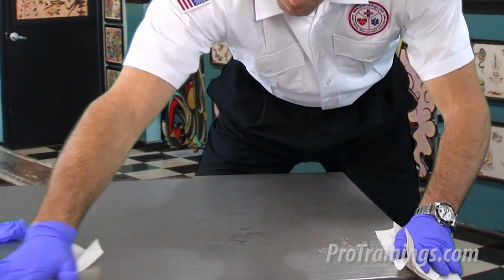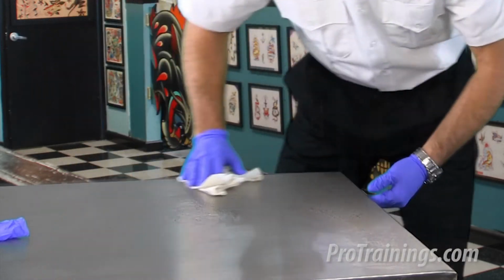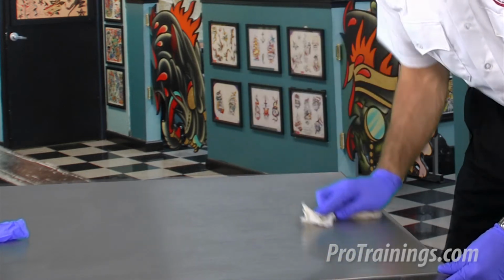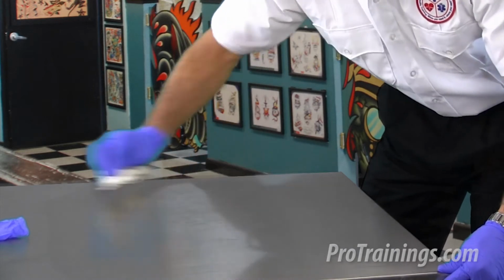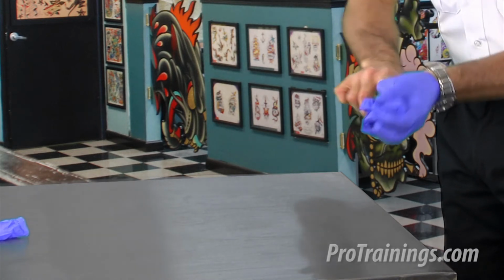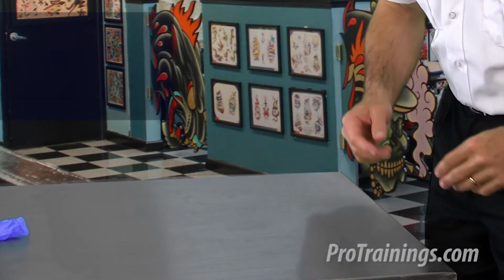Now we're wiping down the surface that's been sprayed with the bleach solution, in this case making sure not to cross-contaminate and spill it off the edges. If it does, then we're going to have some floor to clean up. Once again, glove on glove, skin on skin for removing the gloves. Now I throw those in the trash.